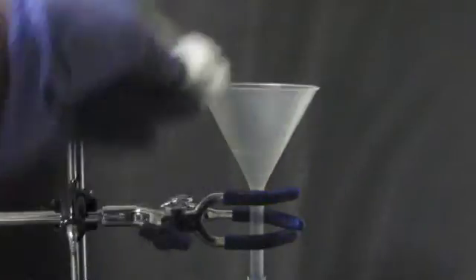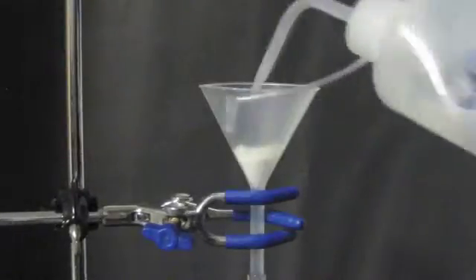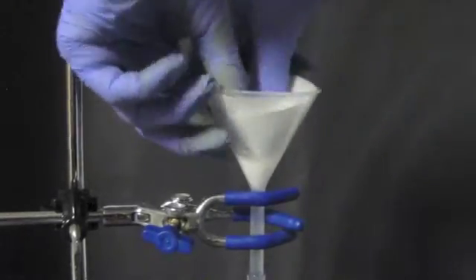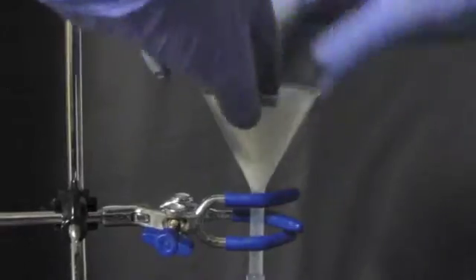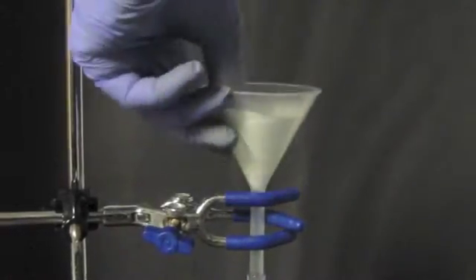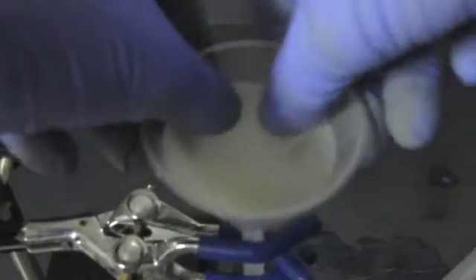Once everything is secure, place a cotton ball in the funnel and wet it so that it stays in place. On top of that, place a piece of filter paper and wet it as well. Sometimes the filter paper will break under the vacuum conditions that we will be applying, so the cotton prevents any solids from being pulled into the syringe. You need to make sure that the filter paper forms a tight seal with the funnel and the cotton, or else you will not get a good vacuum.